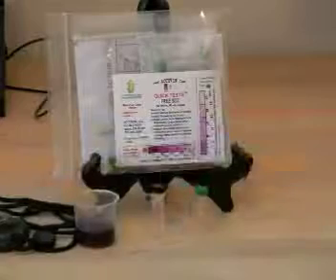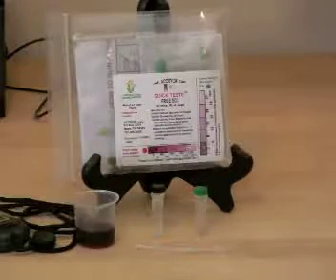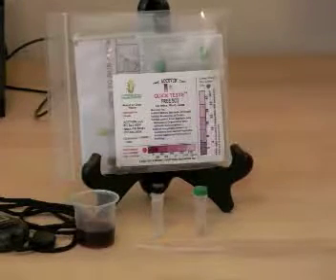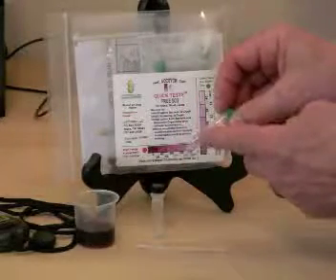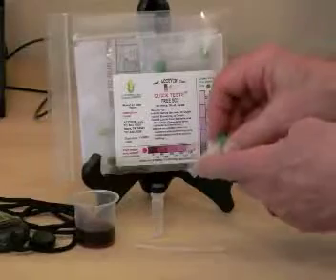For this test, we'll choose a green cap tube because we believe the free SO2 level in this wine sample is low. The reagent adheres to the side of the reagent tube before it's rehydrated.